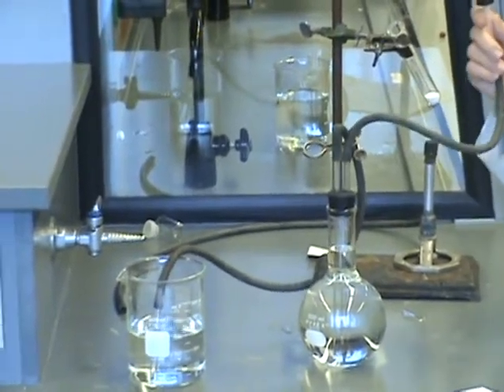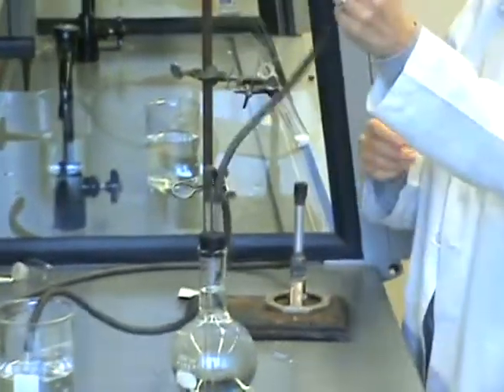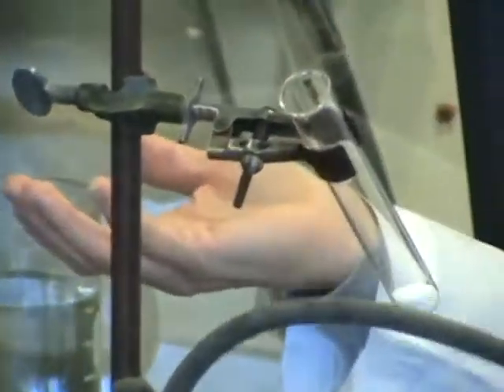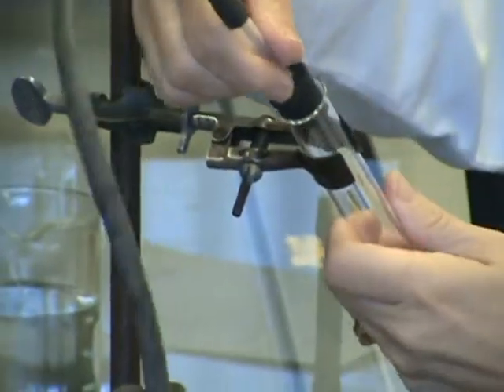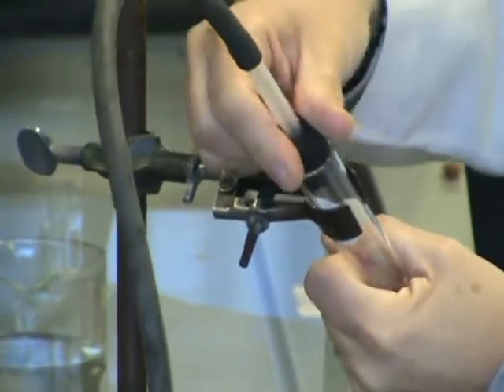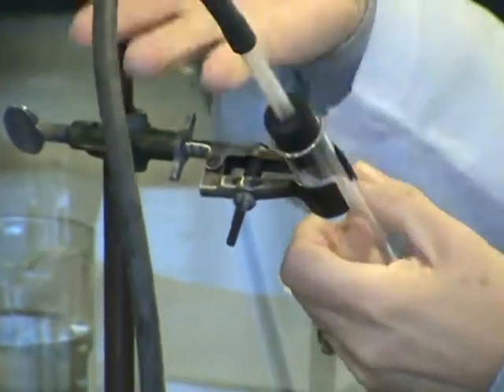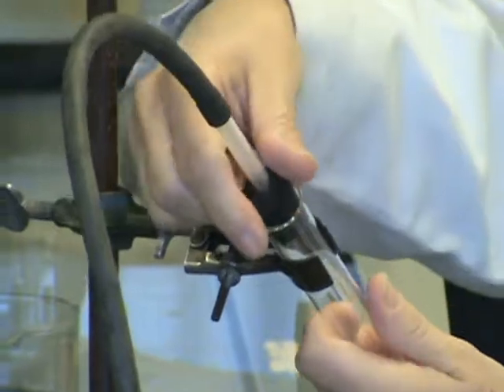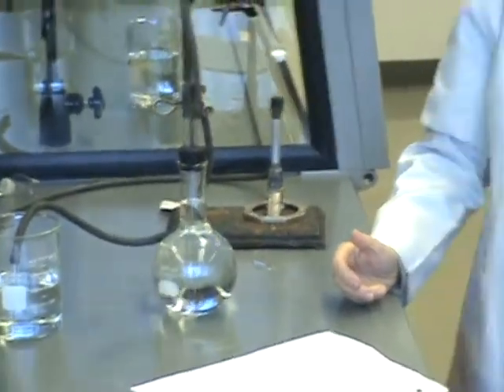Step six says attach the test tube to the rubber stopper end. My test tube's already set up and ready to go. Only now do I put the rubber stopper in here. Push it in firmly, maybe with a little bit of a twist. Again, you don't want that popping out in the middle of the experiment when you're heating it. Okay. Now, on to step seven.